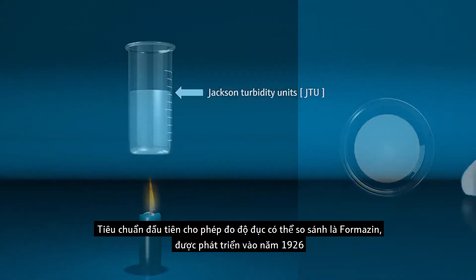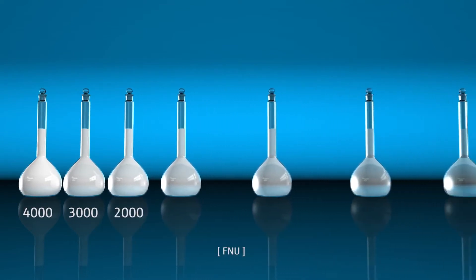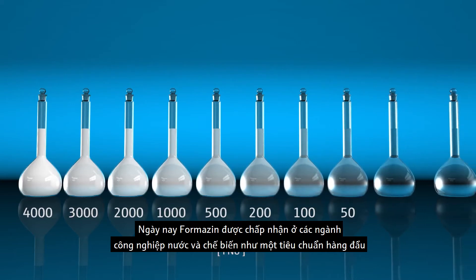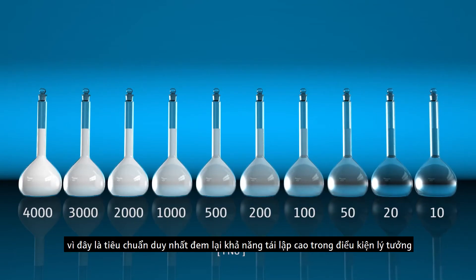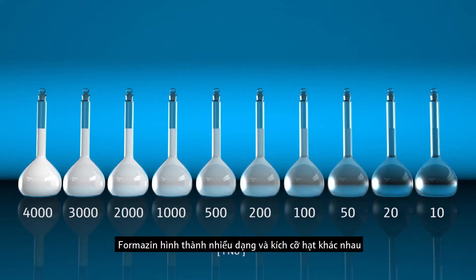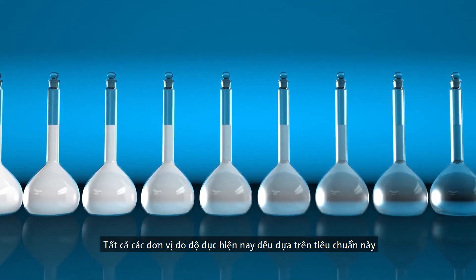The first standard that enabled comparable measurements of turbidity was formazine, developed in 1926. Formazine is still accepted today across the water and process industries as the leading standard, as it is the only standard that can be produced with high reproducibility under ideal conditions. Formazine forms many different particle shapes and sizes, and all current turbidity units refer to this standard.